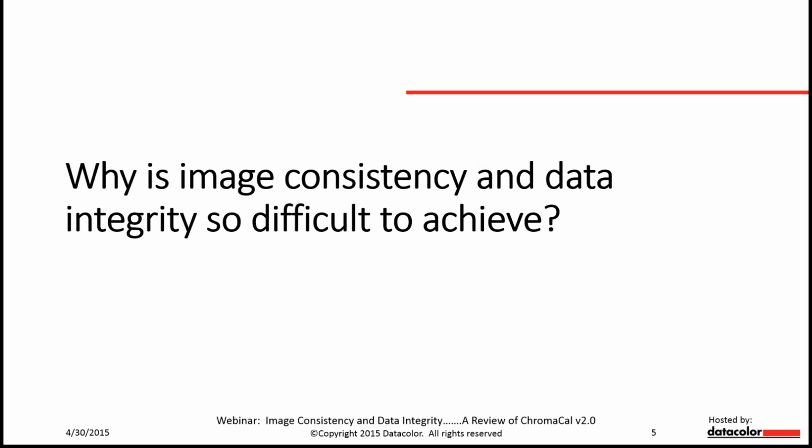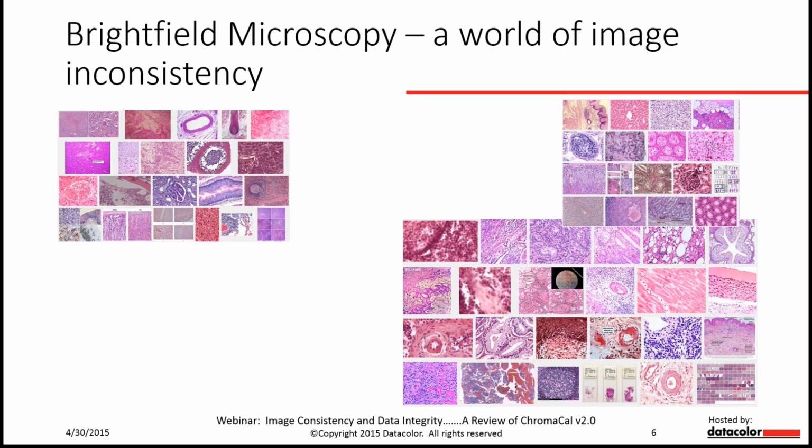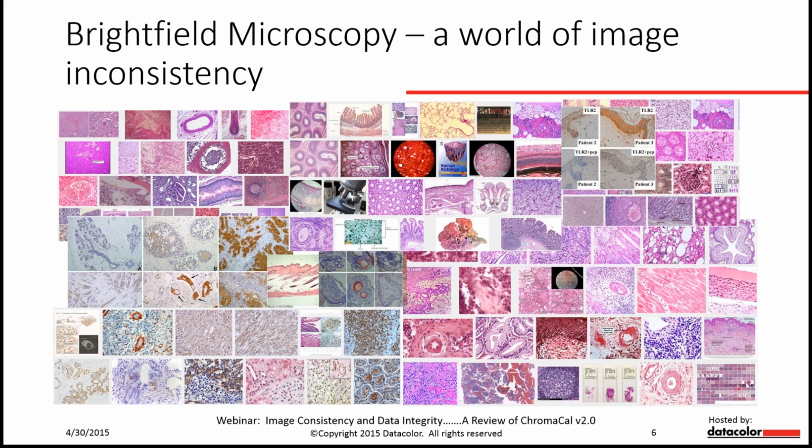So why are image consistency and data integrity so hard to achieve? That's a really good question. We first need to recognize that the world of bright field microscopy is full of imaging inconsistencies. Shown here are just a couple of examples from books and papers, presentations, and websites. Jerry, what's your experience? In my own experience, this is so true to see these images the way that they appear here. They're all over the board in terms of white balancing, contrast, and color inconsistency.